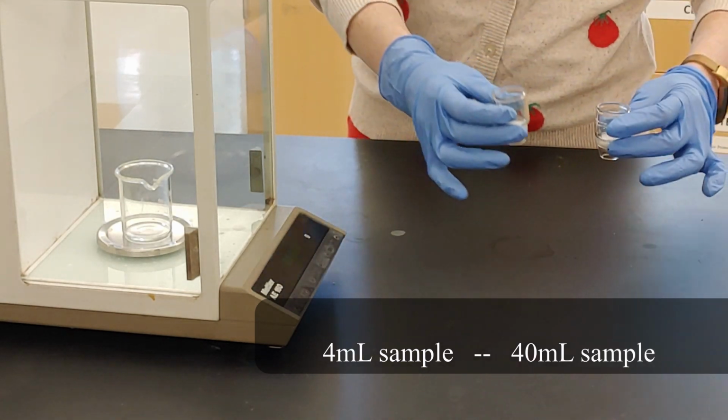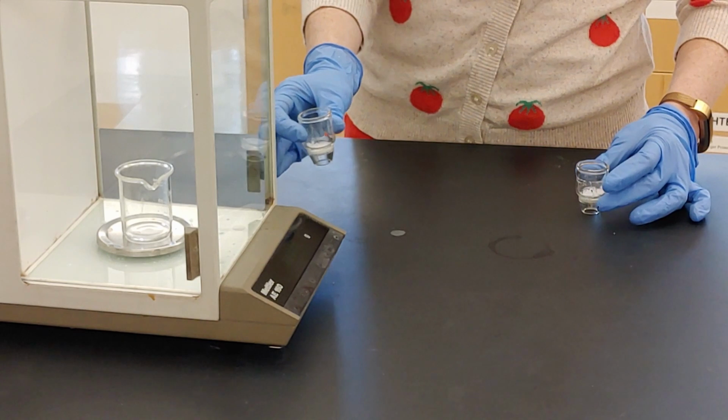Once the product is fully dried, the final mass of the crucible and product can be recorded.